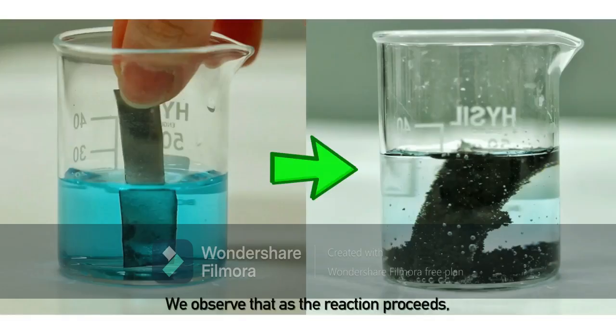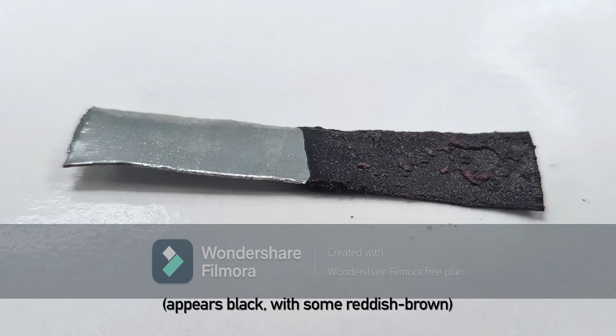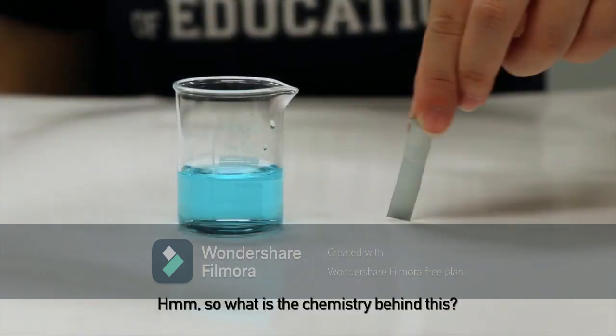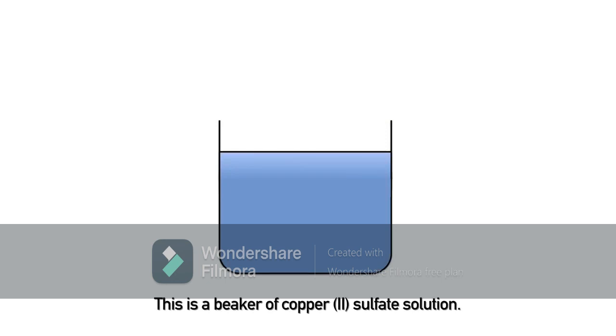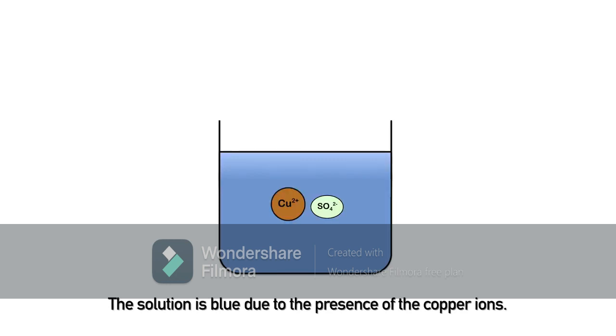We observe that as the reaction proceeds, the solution changes from blue to colorless. In addition, a reddish-brown solid also forms on the surface of the zinc metal. So what is the chemistry behind this? Let's take a look. This is a beaker of copper 2 sulfate solution. The solution is blue due to the presence of the copper ions.